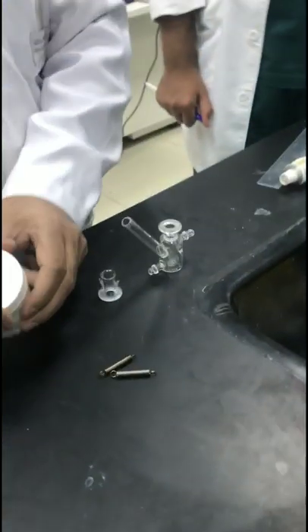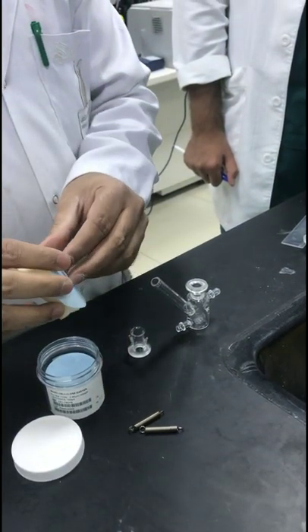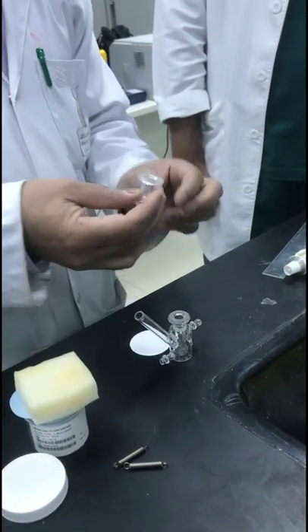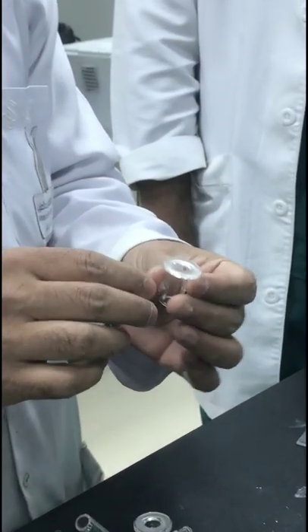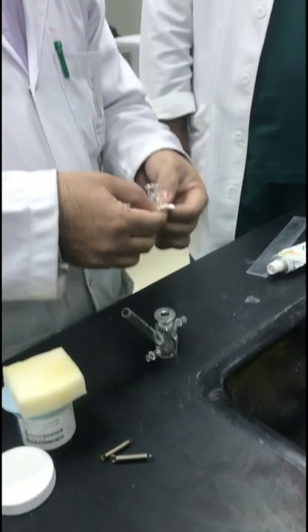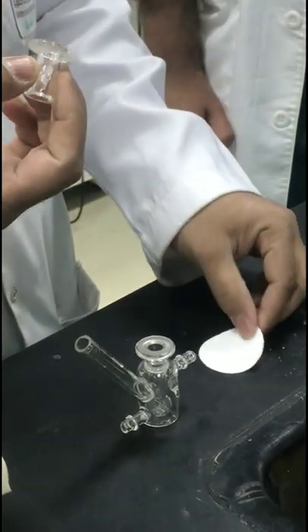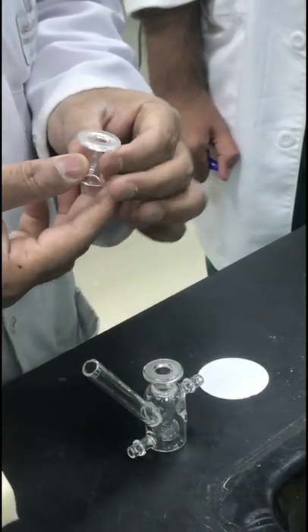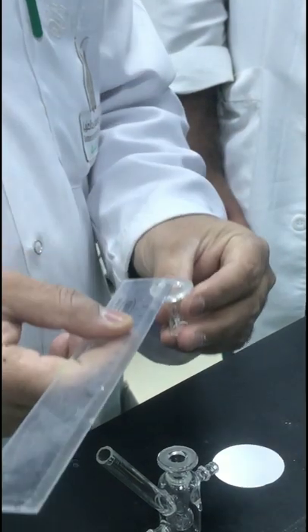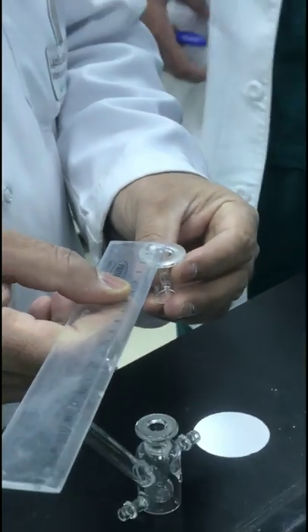Here you place the membrane. You have to cut it to the correct size and put it here. This is the donor compartment, and this opening is called the donor opening. If you place the membrane here and put your drug on top, the drug will cross the membrane. You need to measure the surface area and the diameter of this opening.